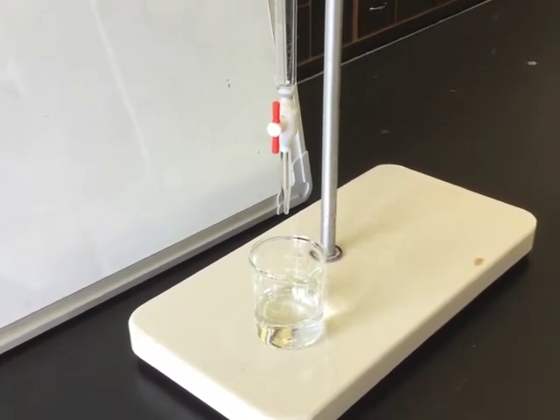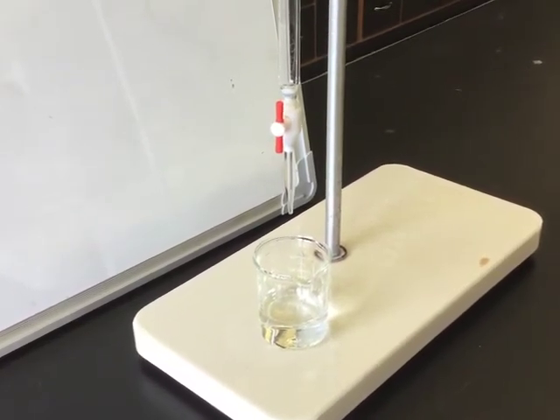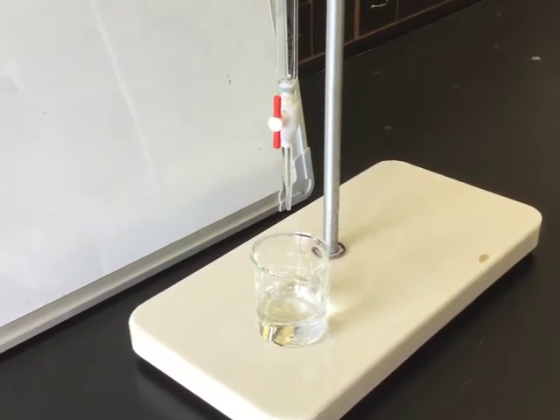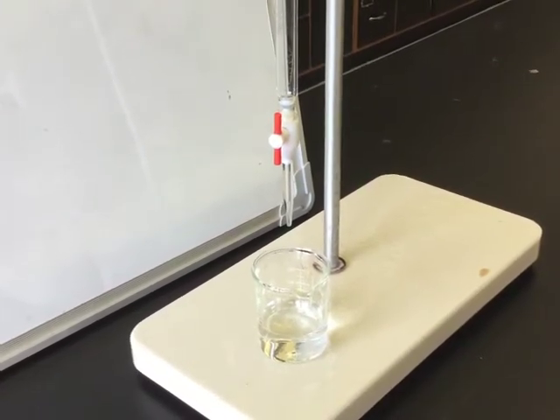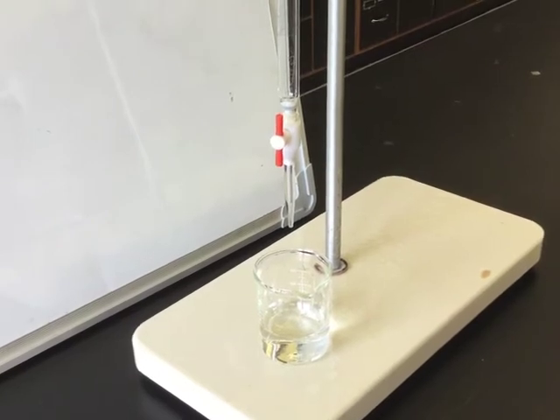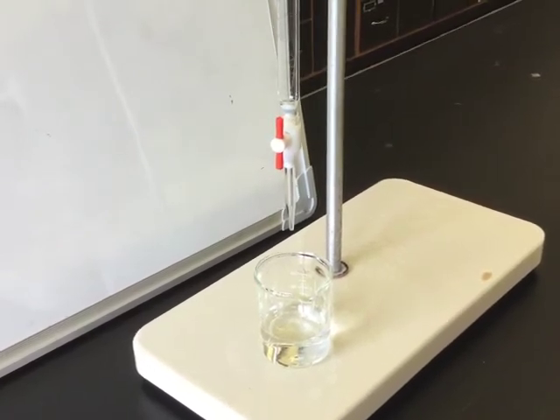You can drain your burette into the same beaker or you can add a little more from your deionized water bottle. Turn your burette upside down with a stopcock open so that it can dry before the next class enters.